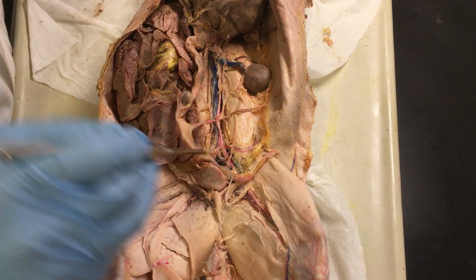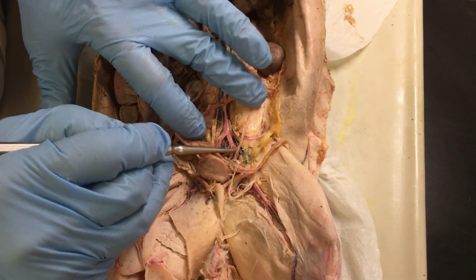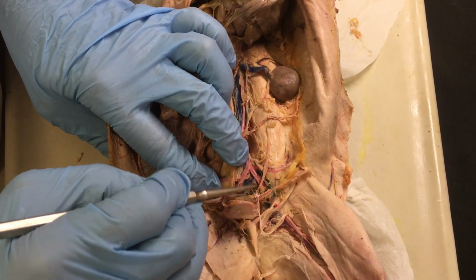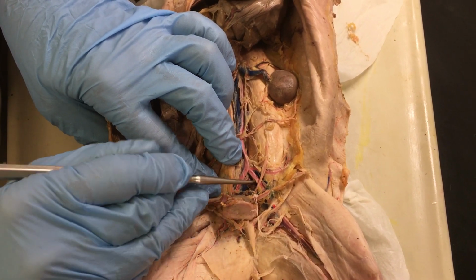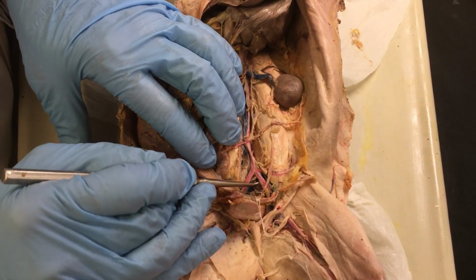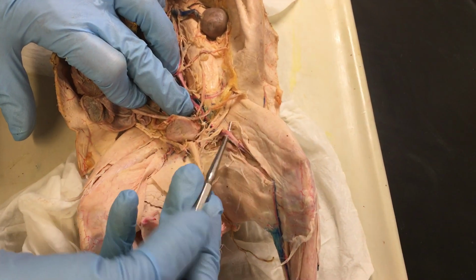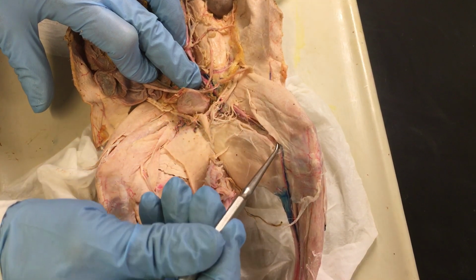This aorta also will branch on the bottom part here, more on the caudal area, and if you can see here, there is a letter Y. So that's the end of it, and then there will be a right and a left. This branching is called the external iliac artery. Iliac because this is the iliac region on the hip. So this is the external iliac artery, which will then go onto the leg, and it will become the femoral artery because it runs all along the femur.